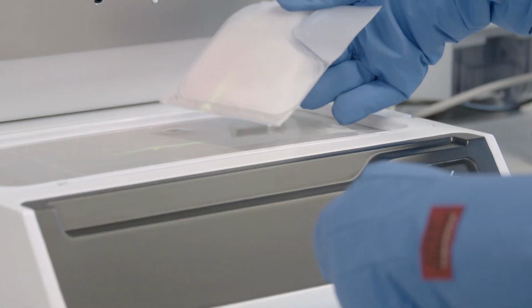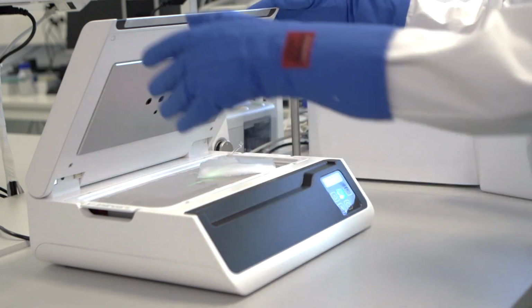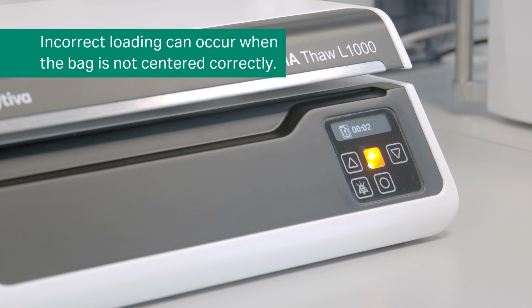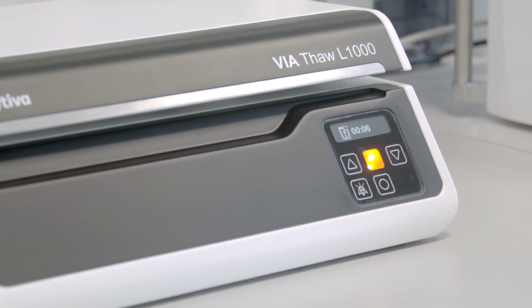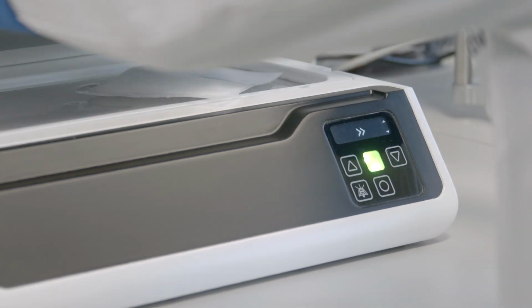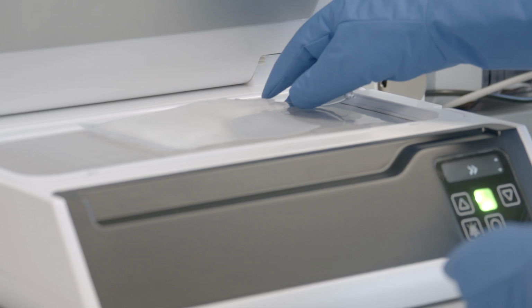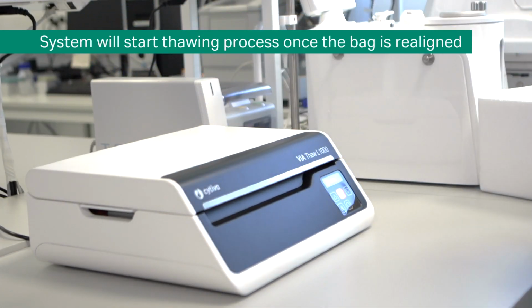If a cryobag is loaded onto the thawing tray incorrectly, it may prevent the lid from closing. Incorrect loading could occur if a bag is off-center or not in line with the markings on the tray. The instrument will respond with a corresponding error alarm. When the cryobag positioning is adjusted and it is loaded correctly, the ViaThaw system will automatically start the thawing process.